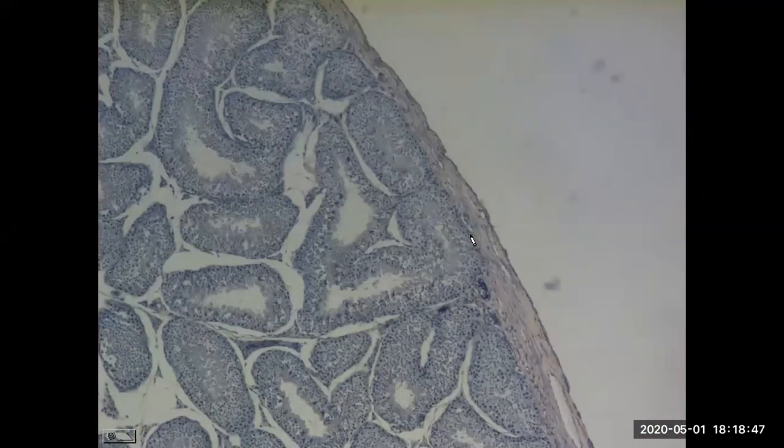So now moving on to the reproductive system, the male reproductive system specifically. This is the histology of the testis. So we could start here with the term the collagenous sheath. Collagenous sheath, one name for that, or the tunica albuginea. So at the surface of the testis.